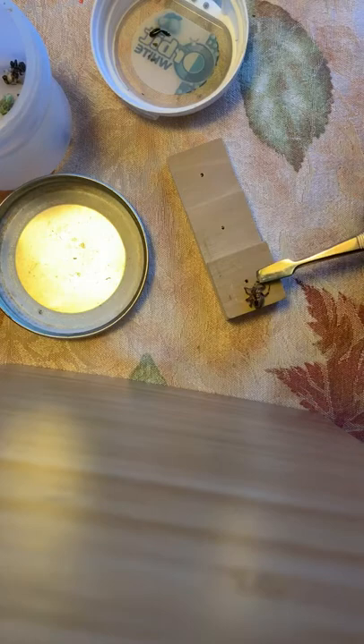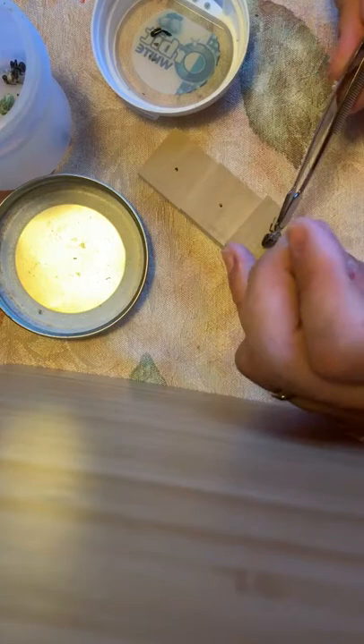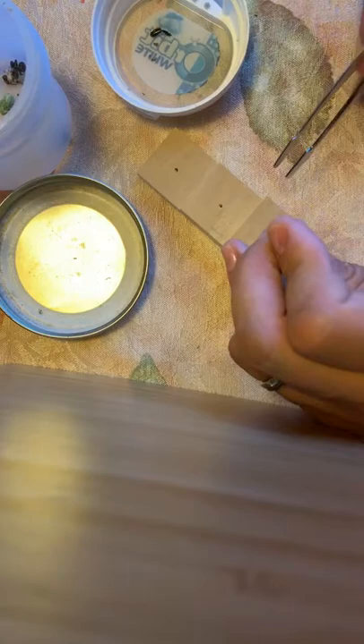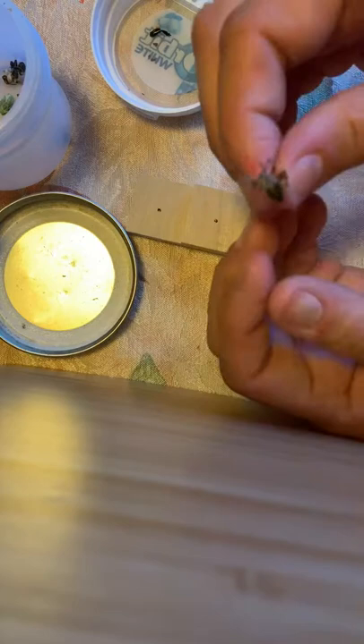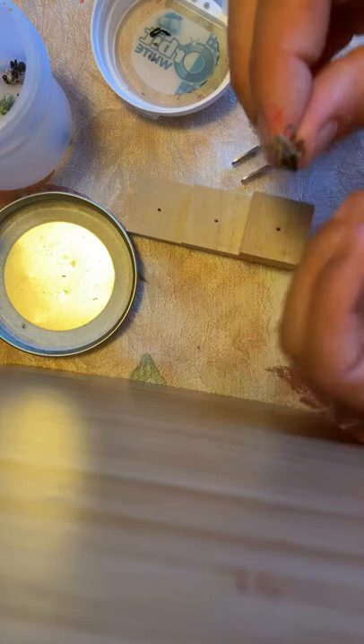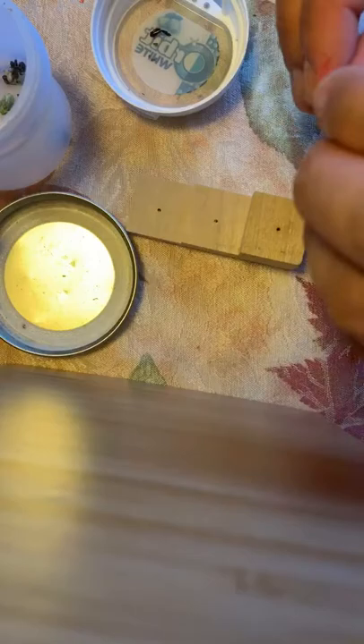You get to see the underside of what he looks like — this specimen is missing two legs, which I'm not too concerned about. We're going to puncture him right here in the thorax, and he's pinned with one leg frozen in the air. You can see this little bit on the abdomen moves. I'm not going to mess with him too much because we want to obviously keep the abdomen attached, which I have done in the past — reattaching it is not fun.